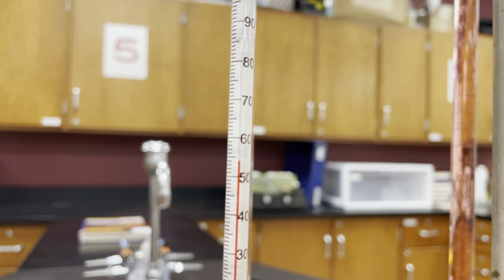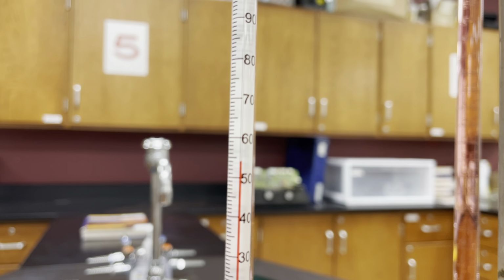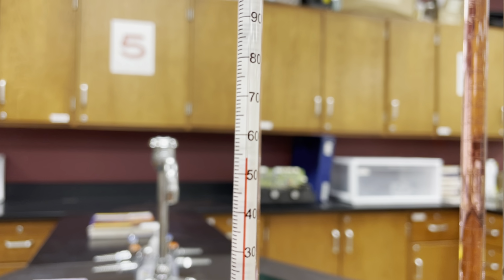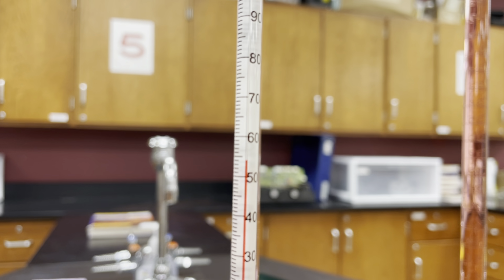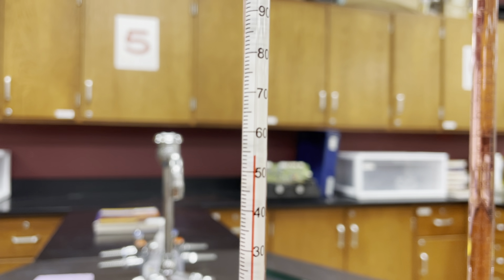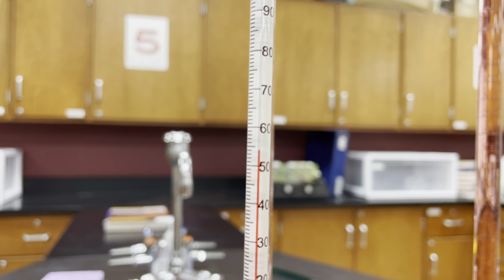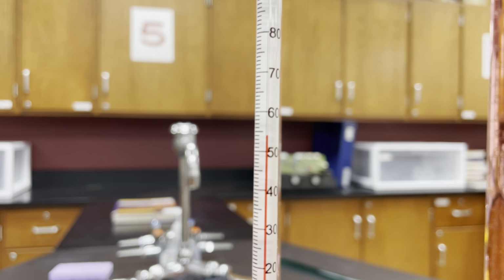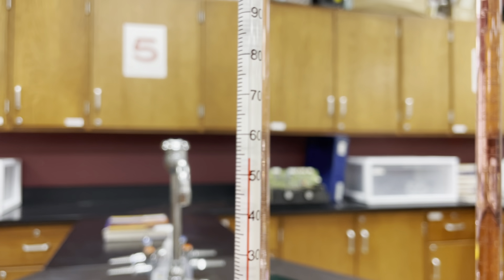Now, if it's a little bit above or below that, since we have the ones place for certain, we can do the tenths place as our uncertain digit. So you could say 54.1 or 53.9. But if you say it right on 54, don't forget to include that uncertain digit, 54.0 degrees Celsius. Then just be sure you know which temperature scale you're using. Typically, we use Celsius in the lab. If you're using Fahrenheit, how dare you? Or, well, maybe you just don't have the right thermometer for it. But typically, we'll use Celsius.